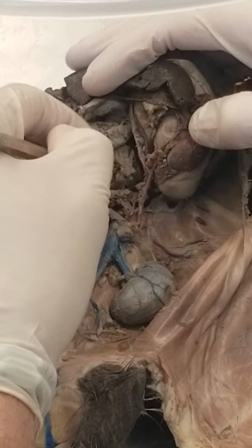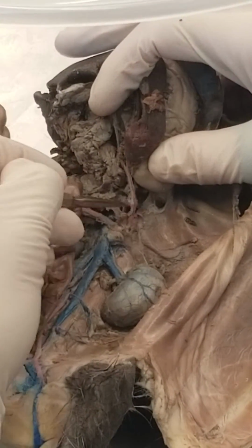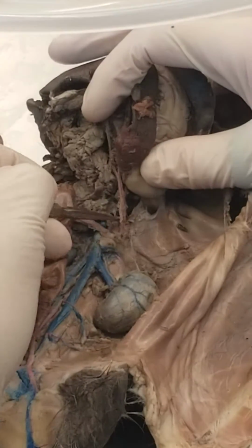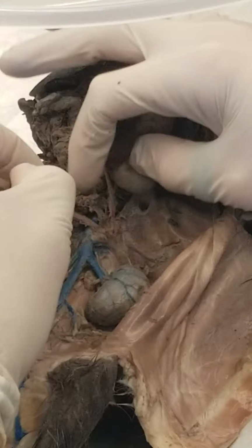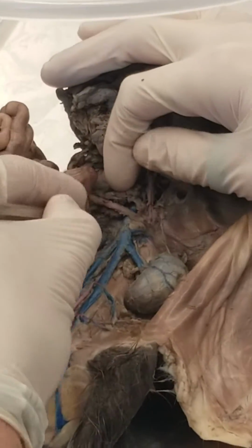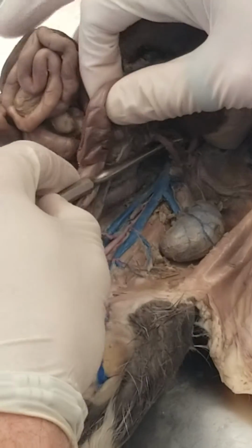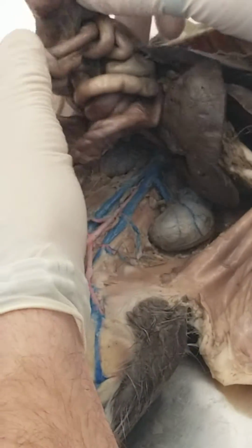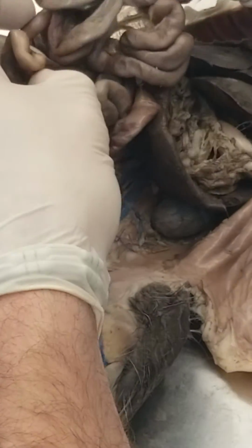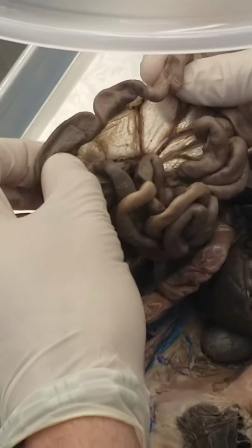So those 4 terms right there, and you need to be able to understand the first branch off the aorta is the celiac trunk to find any of them, okay? Celiac trunk, hepatic artery, gastric artery, splenic artery. Next up, we have this, which is our second branch, and you should know, hopefully, that the second branch is the superior mesenteric artery, but if you don't, you can trace it up to here and be like, okay, well, this is filling stuff up, so where are the blood vessels? Oh, they're in here, and this is my mesentery, making this the superior mesenteric artery.